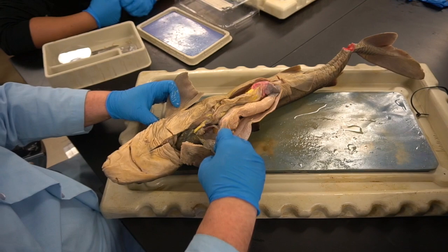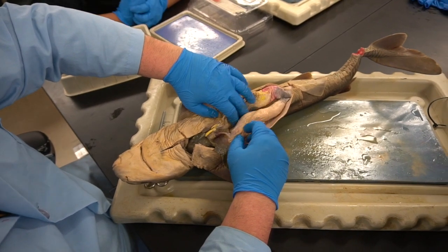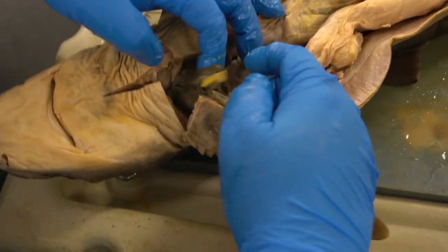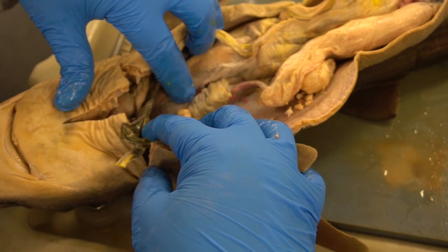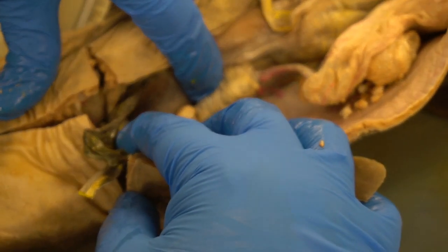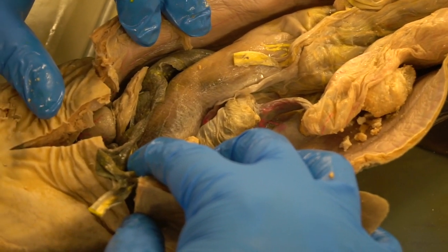We'll pick up. If you pull the liver back out of the way, you could expose the reproductive tract. Now, as this is a female, we have a few things that we want to view. If I retract the liver back, I can see higher up in the abdominal cavity, I have the ovary. The ovary sits higher. If this was a male, this is where the testis is. It would have testes, one on either side. Testis is singular. Ovary is singular, ovaries is plural.